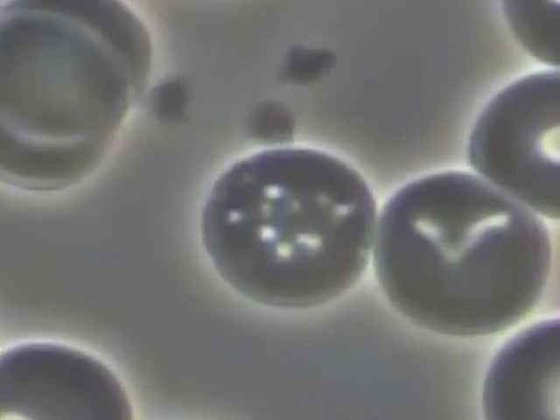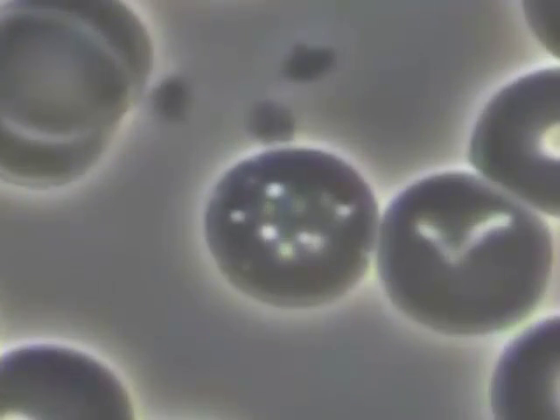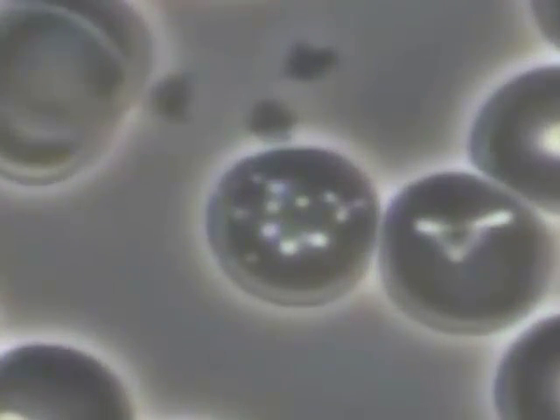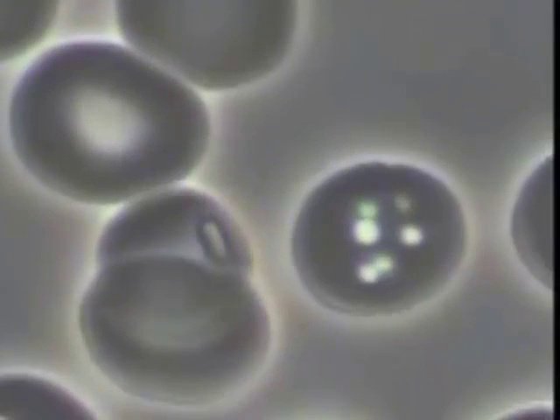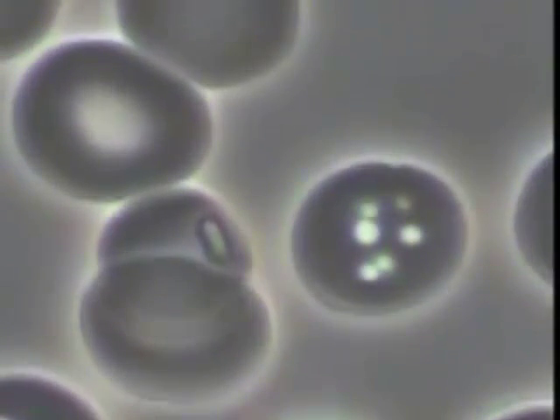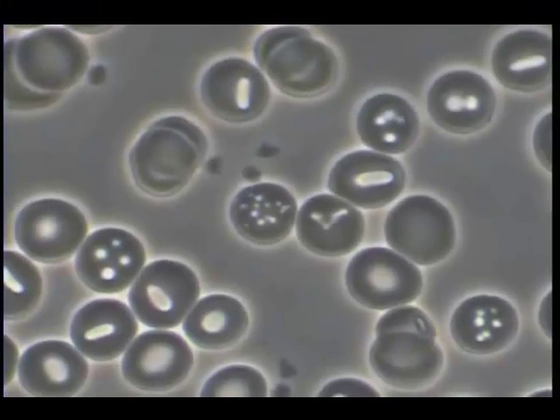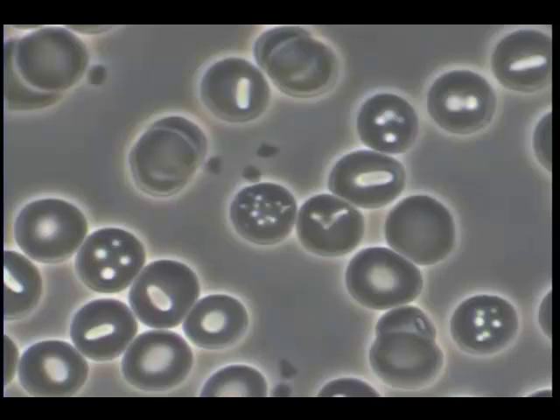These images illustrate a substantial tendency for erythrocytic parasitization. Notice these two artifacts. Here are another two. There's a single lesion on one erythrocyte. Notice that there are many such similar artifacts throughout the sample.